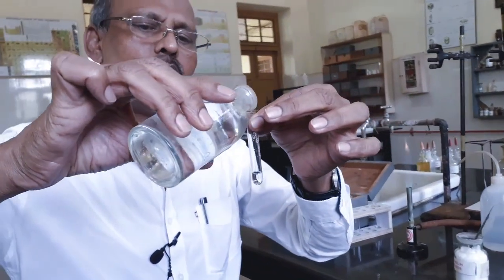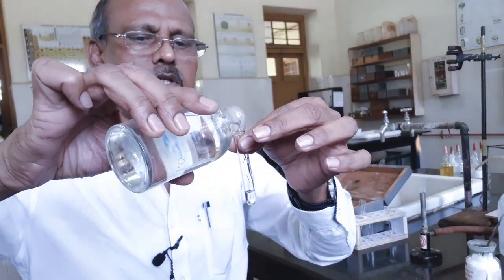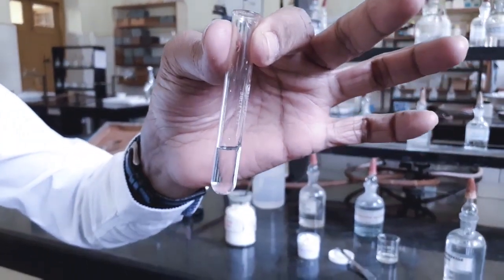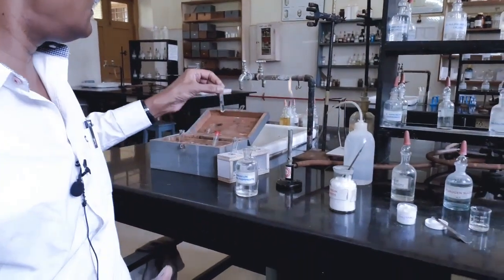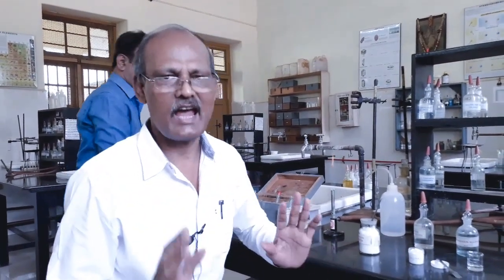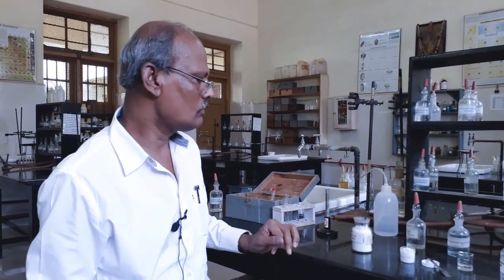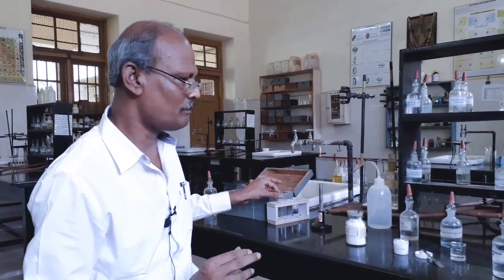See, on adding ammonium hydrogen phosphate, there is no precipitation. So from this we can confirm that magnesium is absent. We have already carried out the test for ammonium basic radical. It is absent. No need to repeat. Now we have reached the last stage of analysis of basic radical.